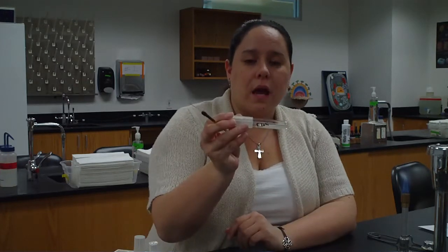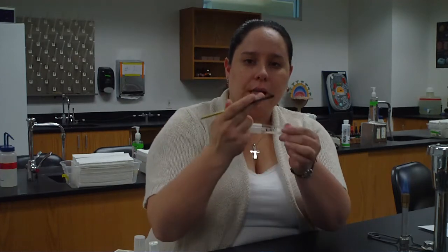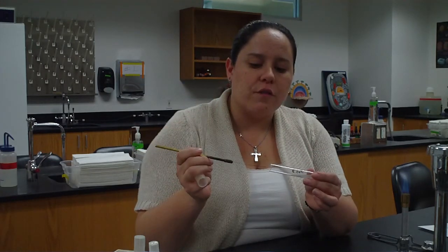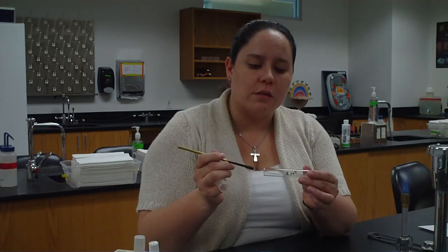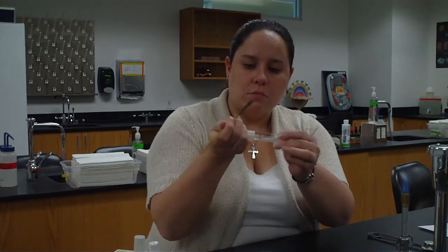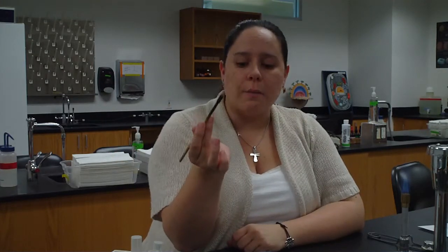Now I'm going to take something out of one of my inoculated slants. Notice I've got my loop like a pencil in one hand. I pick up the inoculated tube in the other. I use these fingers, 3 and 4, to take the cap off. Don't put it down on the table. We want to keep it in our hand. And I'm going to take my sterile loop and go into the very front of this slant and pick up a little bit of bacteria from the front. Close it up. I put the cap back on and put that down in my rack. So now I have bacteria on my loop.